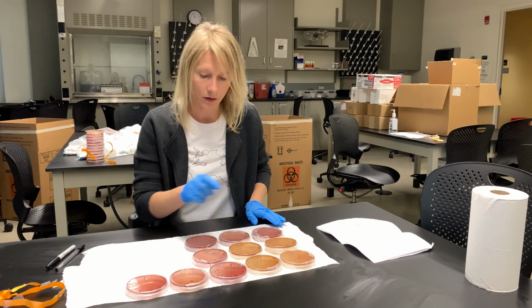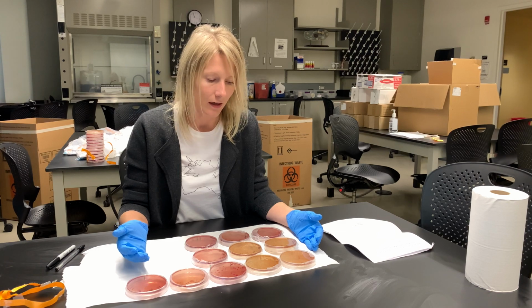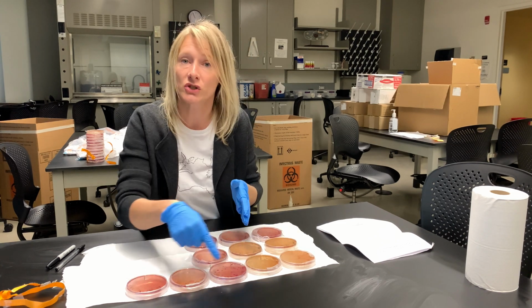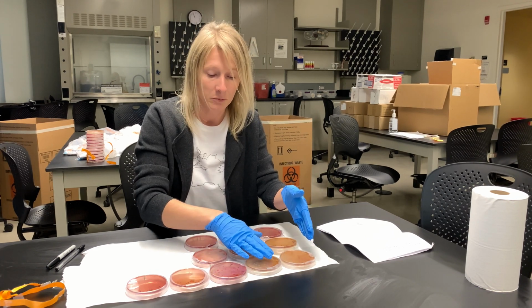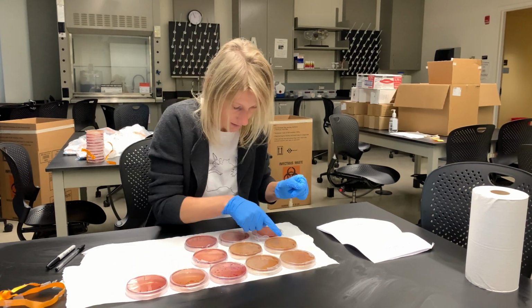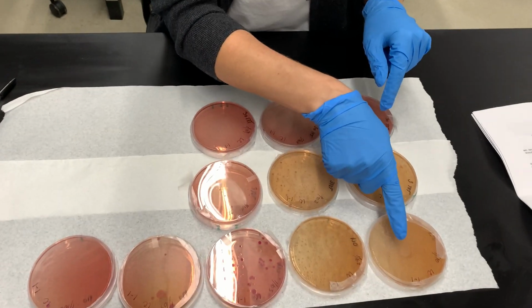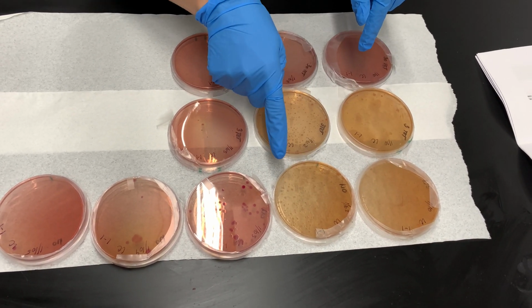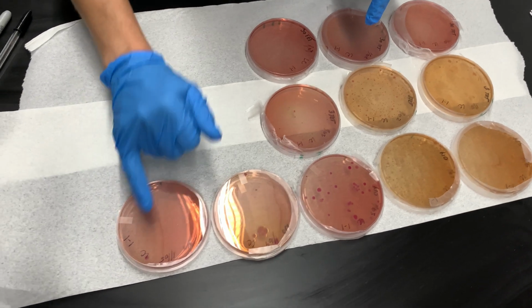First, I will look through them to see if it makes sense. If I am going from the lowest to the highest dilutions, the colonies should be diminishing. It should be the most colony count on the first one, and then basically 10 times less each time. For most of my plates, that makes sense. There are non-antibiotic plates. Seems like a lot of colonies over here, fewer at 10 to the minus 2, and an even lower number further up to the 10 to the minus 5.